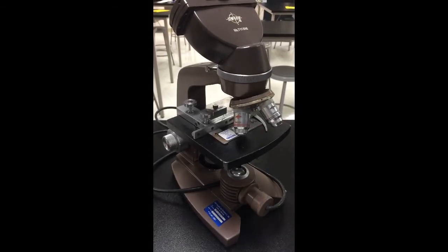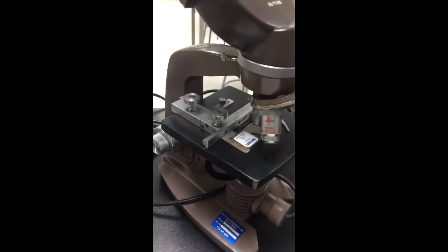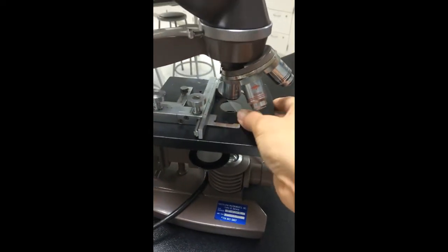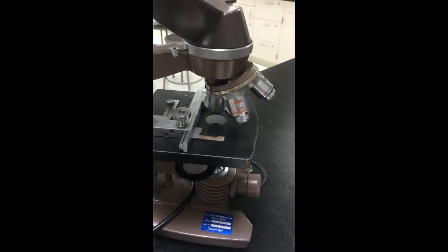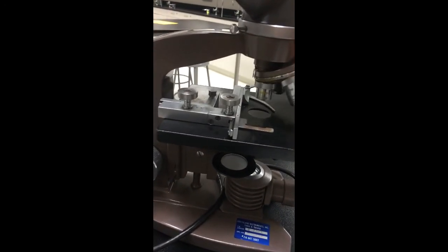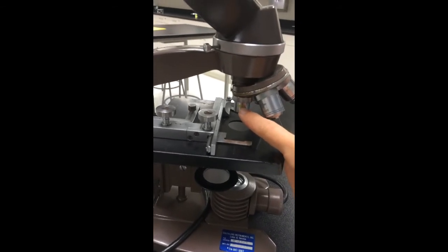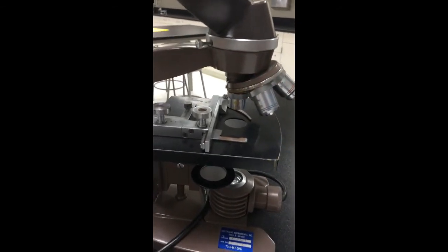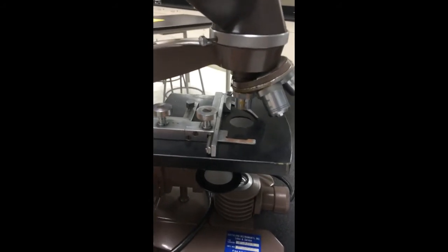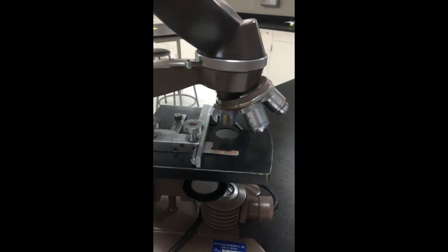Now, once I've finished using the microscope, I'm going to return it back to its resting state, which I'll describe for you here. So I'm going to want to remove my microscope slide and put it back in the classroom. And then I want to reposition the microscope so that the lowest power objective, or the lens I started with, is back in the original position. I then want to bring the stage up, so I'm going to move it as high as it will go, close to the lower power objective lens.